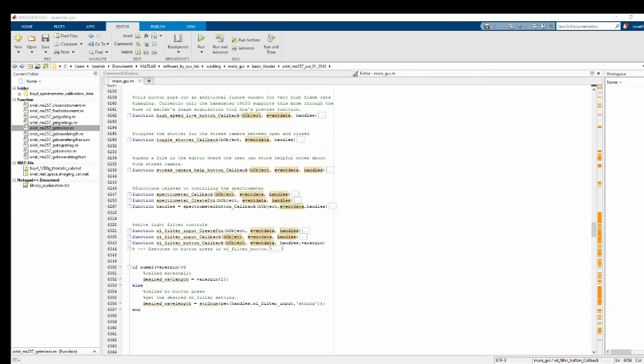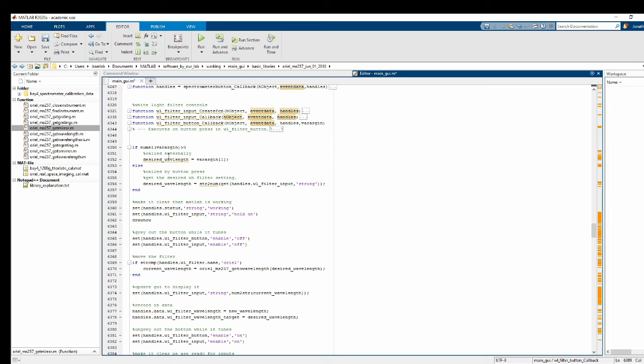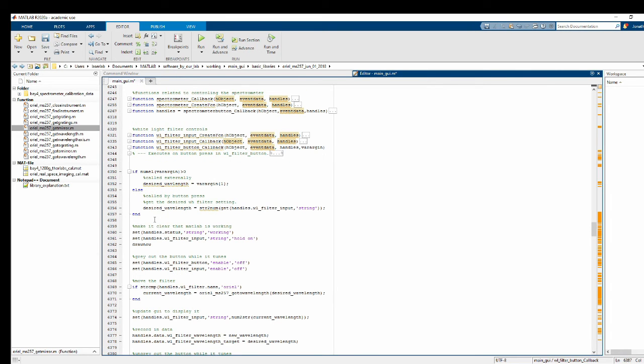So next, let me just go ahead and copy the rest of this whole block of code here. Okay. So now, all right, make it clear that MATLAB's working. That's just putting the string up top and setting it to say working.